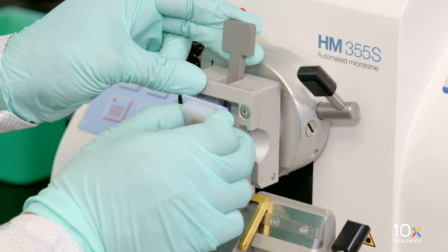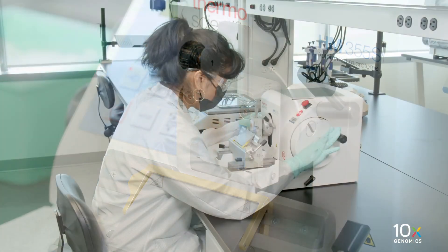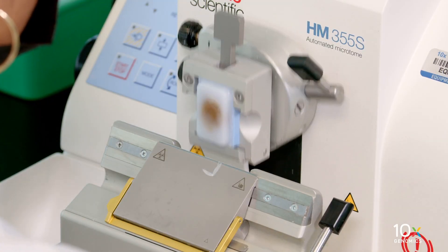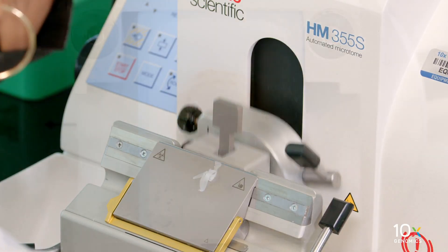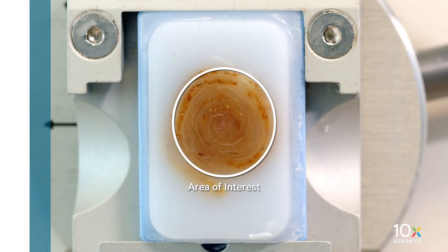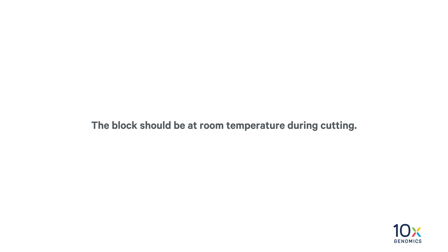Place the tissue block on the microtome specimen clamp. Cut the tissue block at 15 microns until all of the edges of the tissue are exposed, or until the area of interest is exposed. The block should be at room temperature during cutting. We have exposed the tissue.